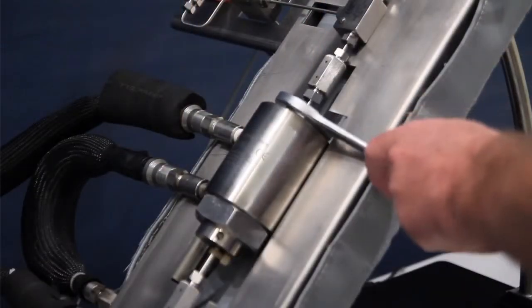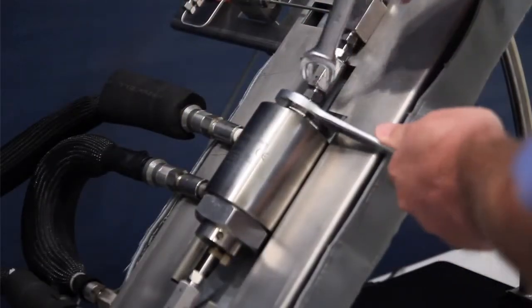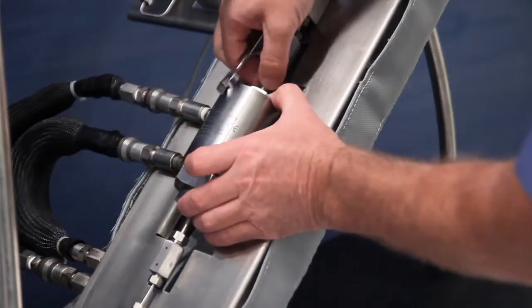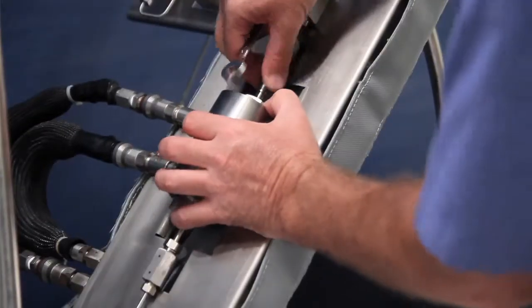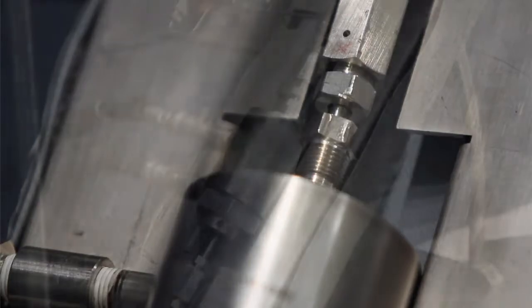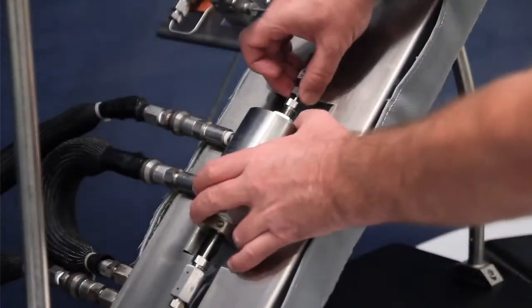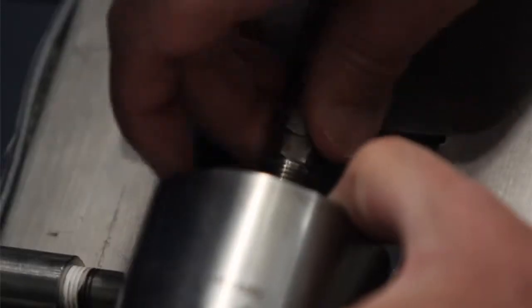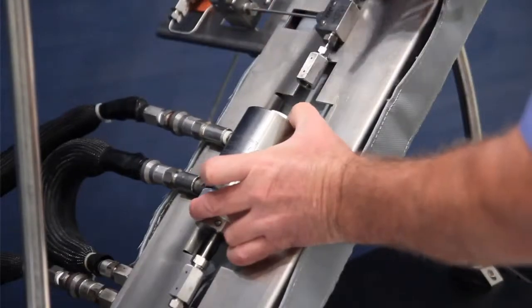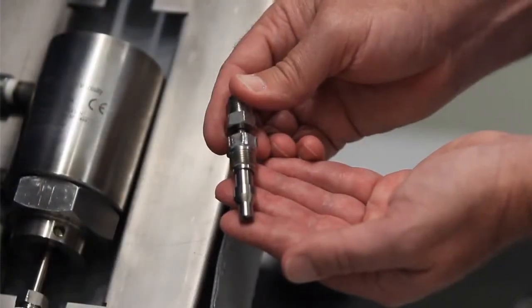Next, you need to remove the piston. Remove the low-torque nut by using the supplied wrench turning counter-clockwise. Next, remove the upper reducer. Now, pull away the low-torque nut and place the nut to the side as we will use it in Chapter 3.